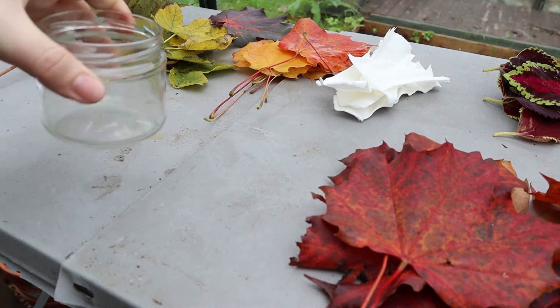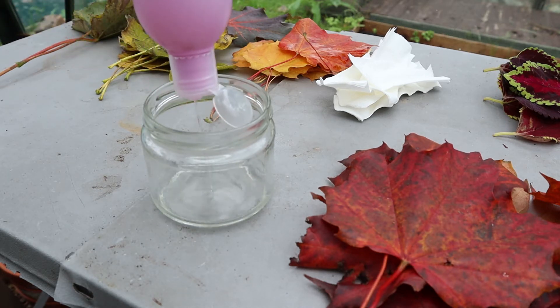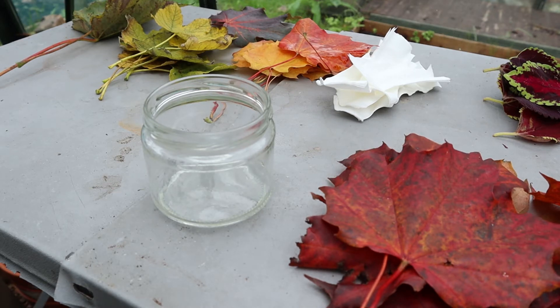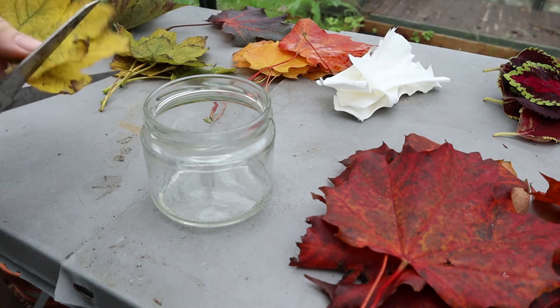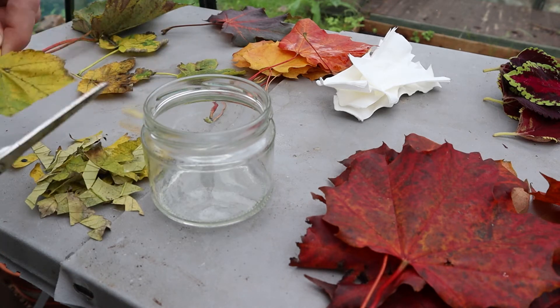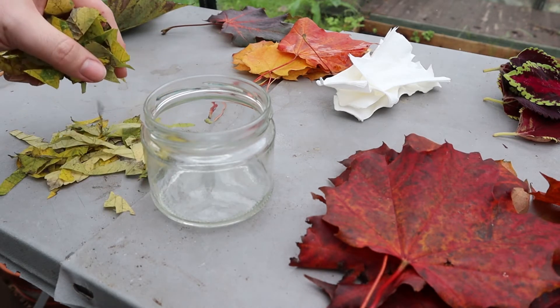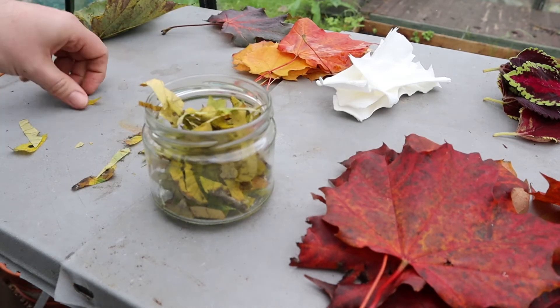Next you're going to need your jars — we'll do one at a time. I'm going to put about a tablespoon of acetone in there, just enough to cover the bottom. Then get your scissors — or you can just use your hands — and cut the leaves up into little pieces and stick them in the jar with the acetone. I'll just do that quickly.